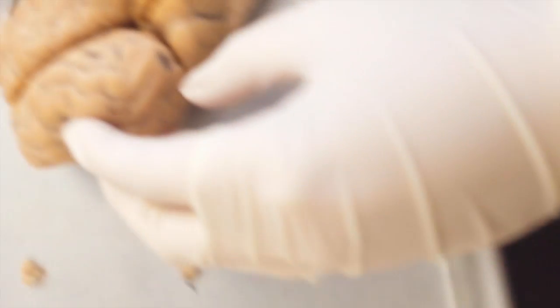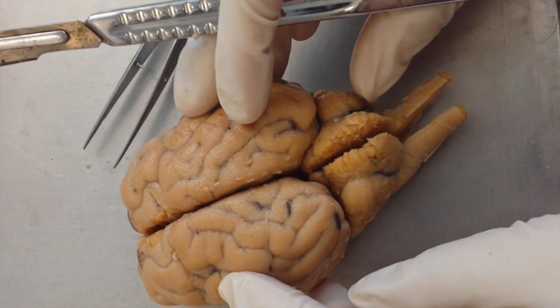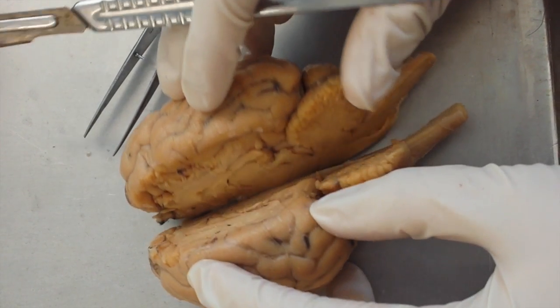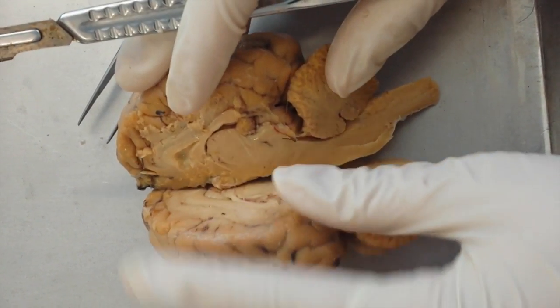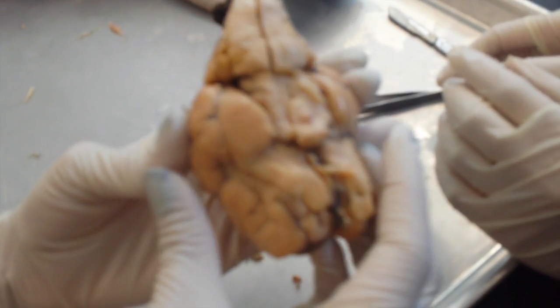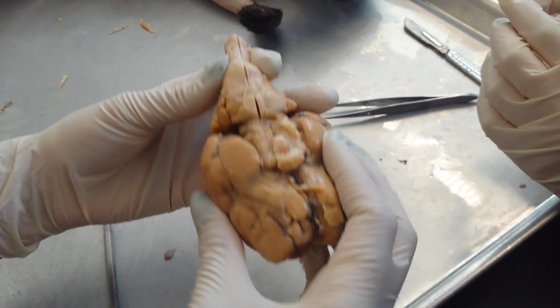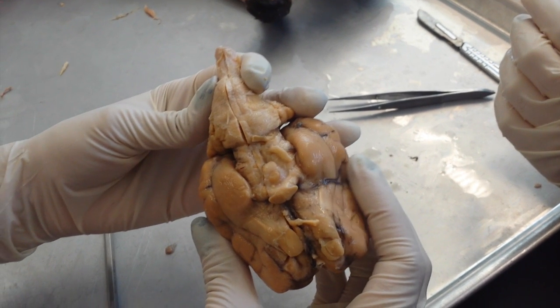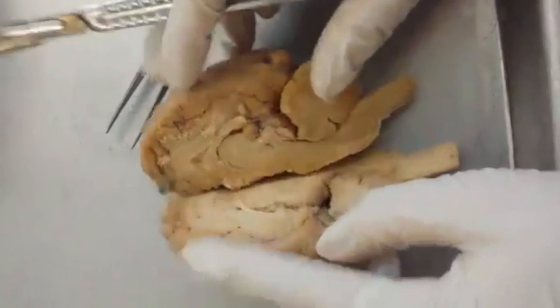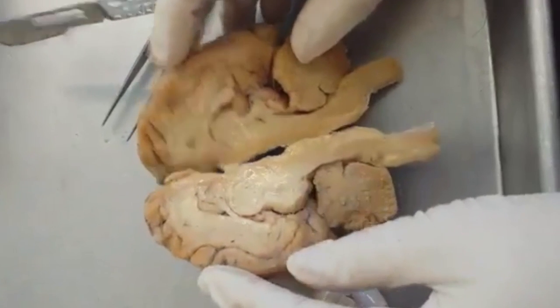As an optional assignment, we had the chance to dissect a sheep's brain. This was an amazing opportunity since we were unable to do anything with the cat's brain. We had to separate the sheep's brain into left and right hemispheres. We had to identify many components of the sheep's brain, such as the parietal lobe, frontal lobe, cerebrum, cerebellum, which is found posterior to the cerebrum, the transverse fissure, the longitudinal fissure, and when you separate the brain into the two hemispheres, we were able to identify the lateral ventricle, the medulla oblongata, and the thalamus.